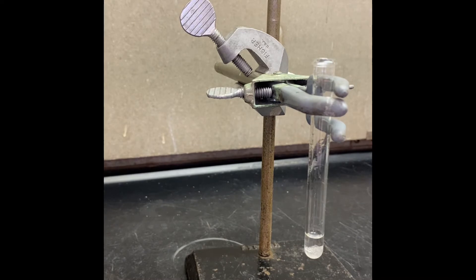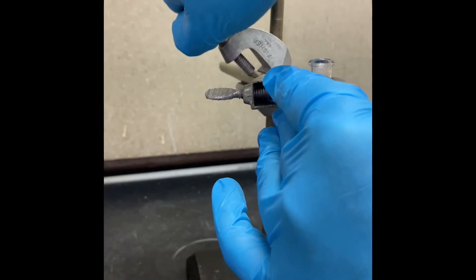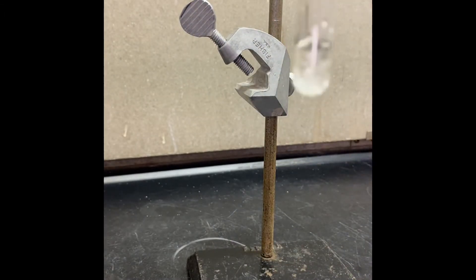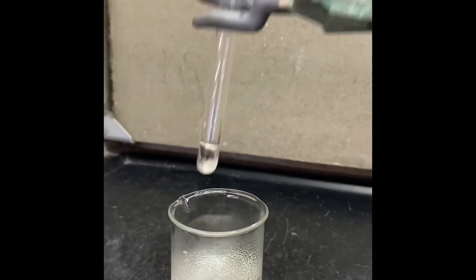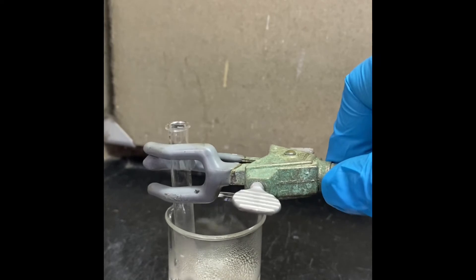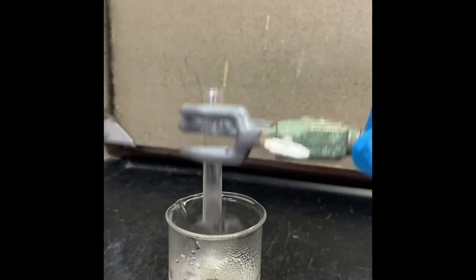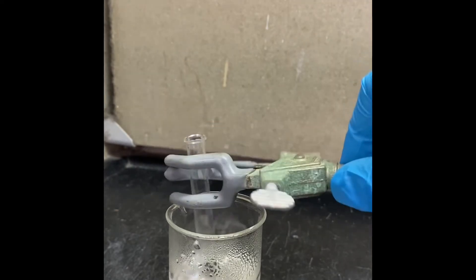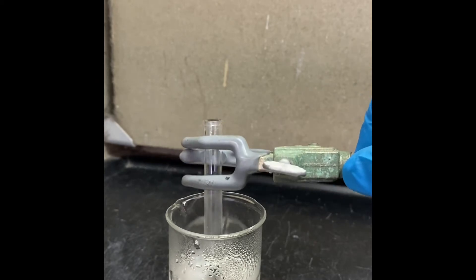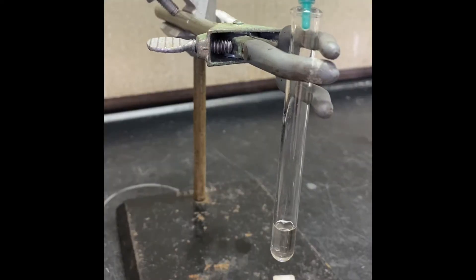1,4-dimethoxybenzene and now I am going to try to dissolve that. May I need a little warm this up with the hot water which I did prepare already. I am just going to try gently heat that up to dissolve it. I am going to add 0.2 ml of tertiary butyl alcohol.